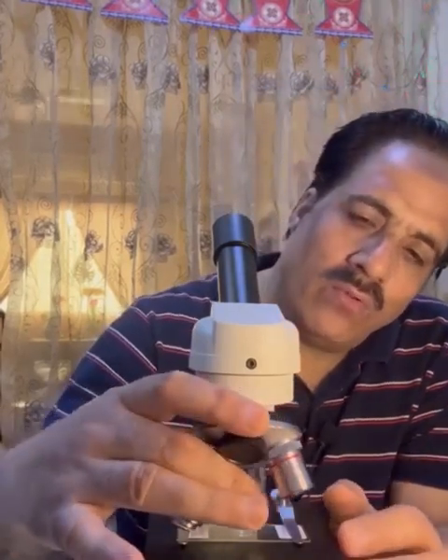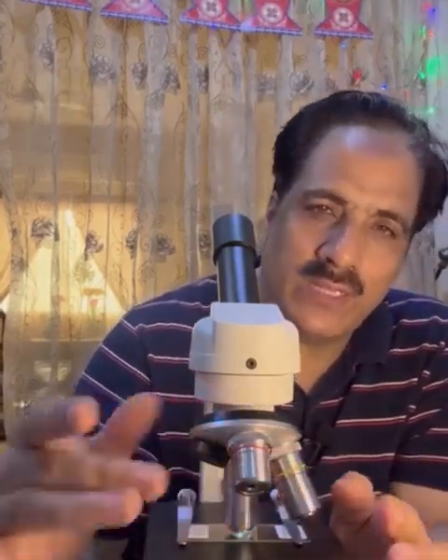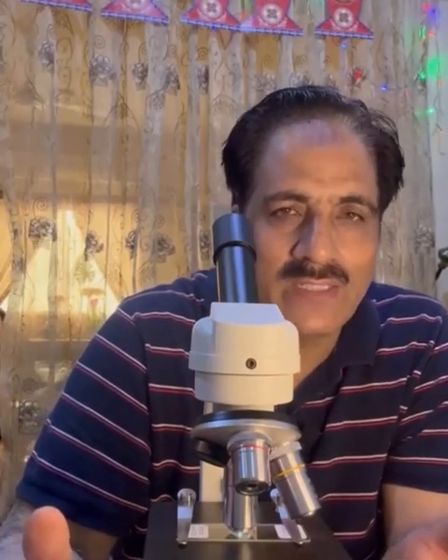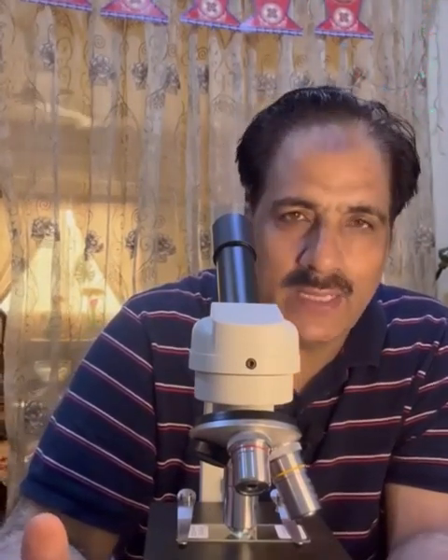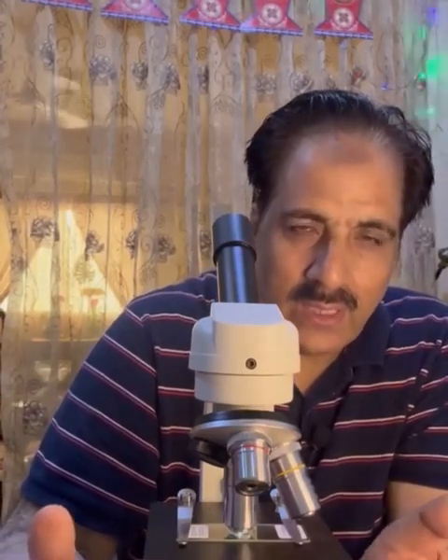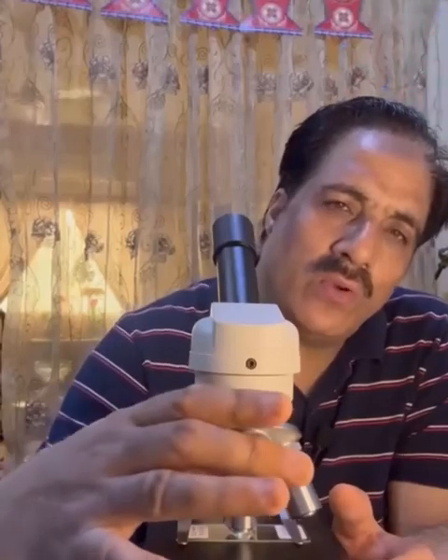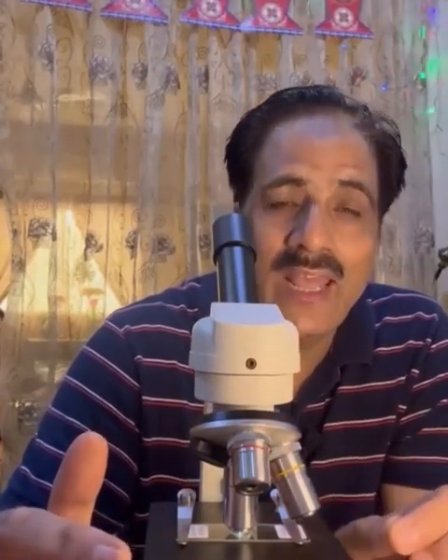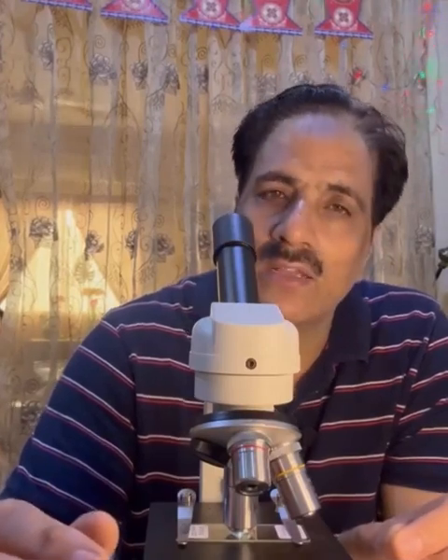Power 40 we usually use to make the individual cells, and the second part of the microscopy is always making an enlarged diagram of some individual cells they tell us to focus on. For example, they tell us to focus on the epidermal cells or the cells in the center of the specimen. So in that case, we use power 40 to get a better view of the cells, and we will select those cells as per the question they are asking us for.